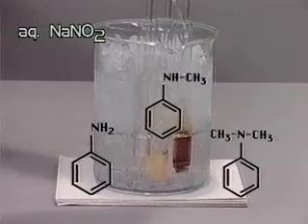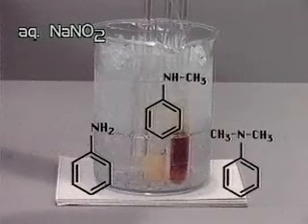Tertiary amines undergo reaction by ring nitrosation, forming colored compounds.